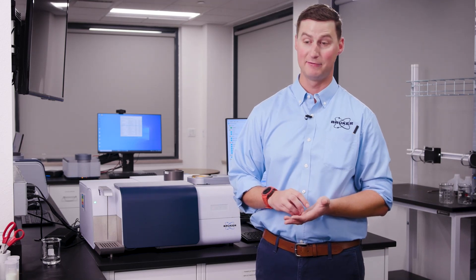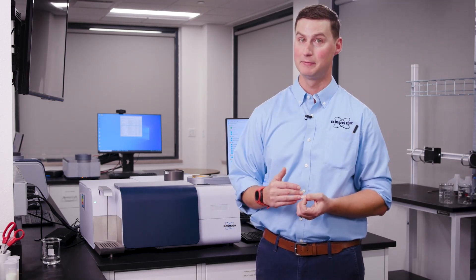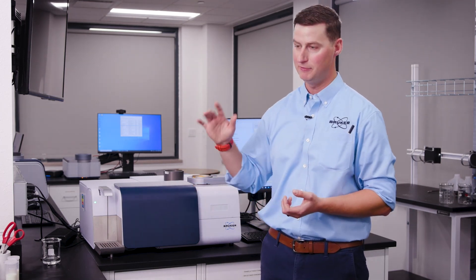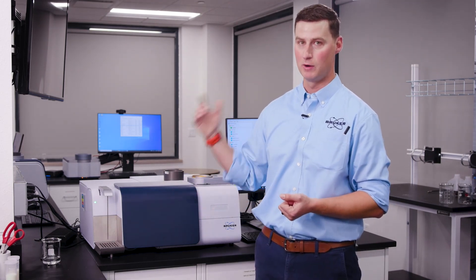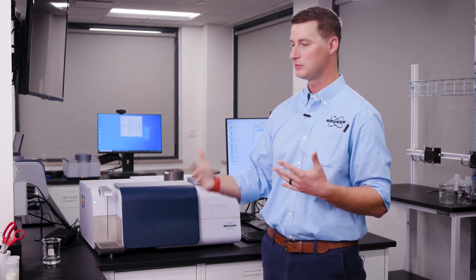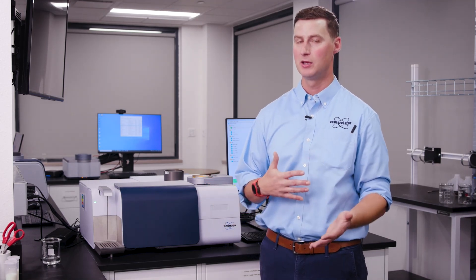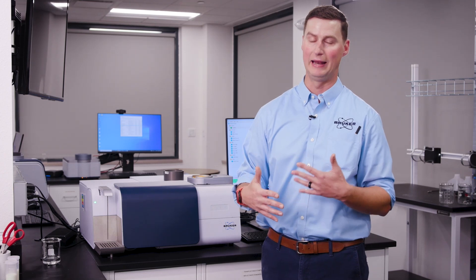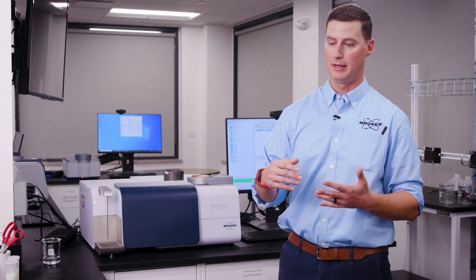There's also an emergency clean, and that emergency clean time is customizable. By default it's set at 10 minutes, but I have some customers who drop it to the minimum of one minute, so every time they run a sample, a minute later it does a clean. The emergency clean actually performs an advanced clean, so it really cleans out those lines well. There are a number of options — manual or automated — and it depends on your comfort level and what products you're running.